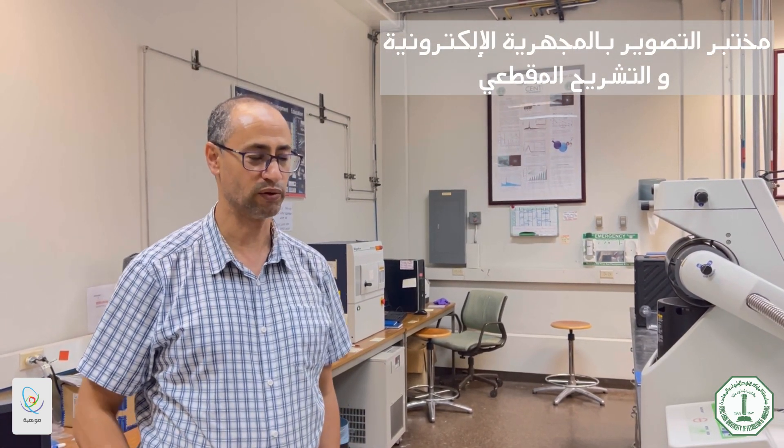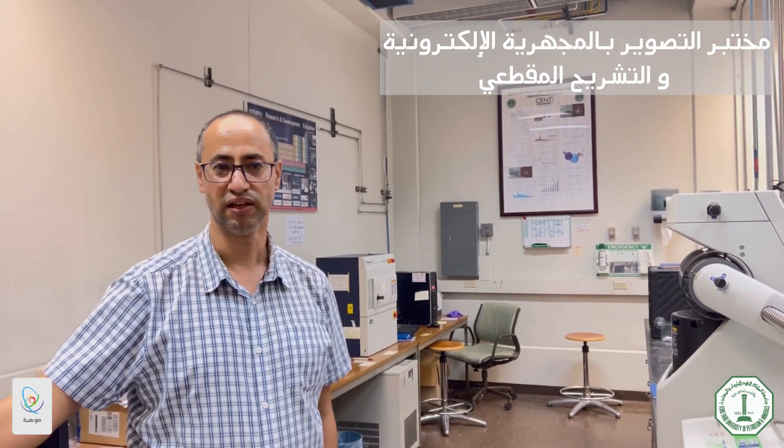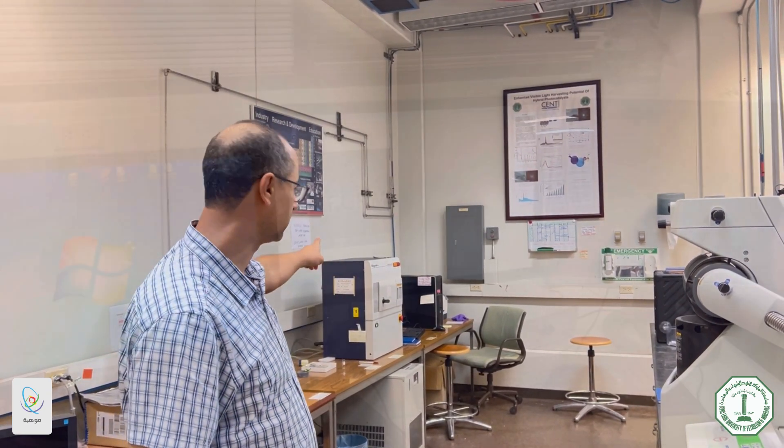We have different techniques here in the lab. We call this the Field Emission Scanning Electron Microscope. And that's very exciting.